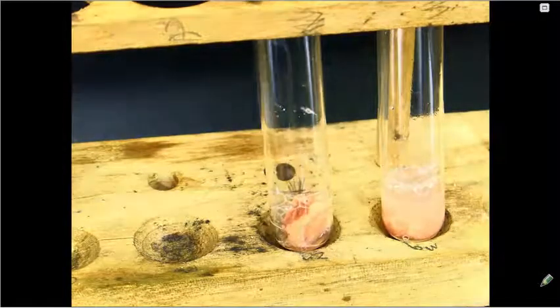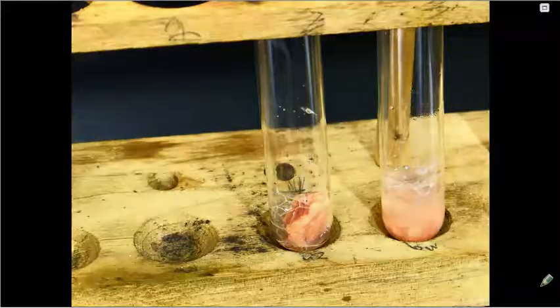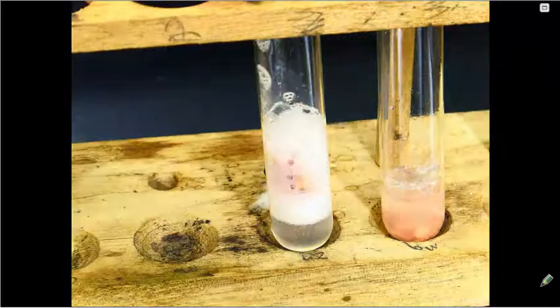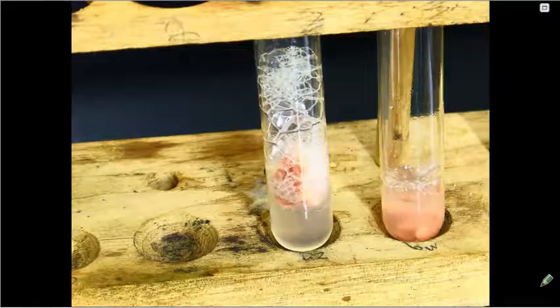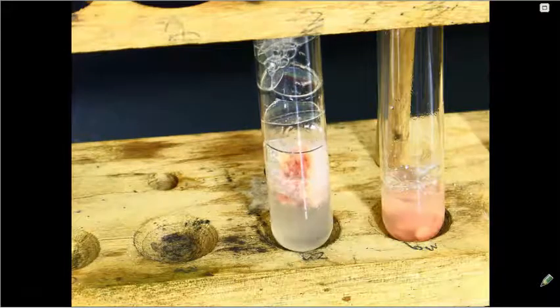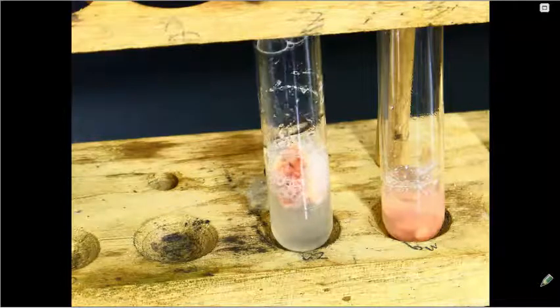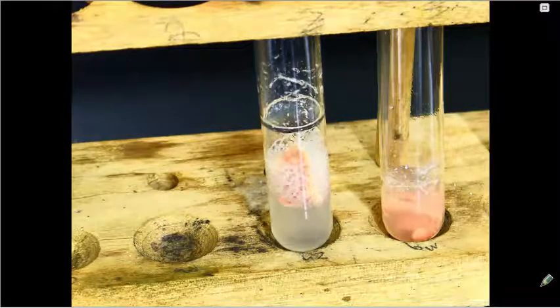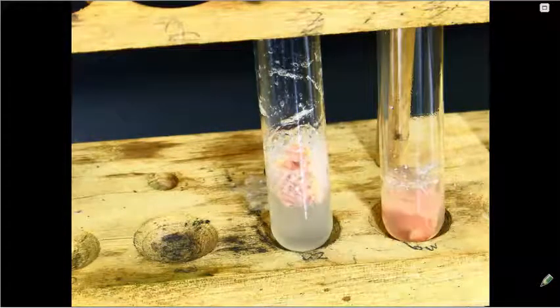I'm going to go back to our first test tube and add an additional 2 milliliters of hydrogen peroxide. Is it still having a fast reaction in that first one? So is catalase reusable? So is that first piece of liver able to continue doing that same reaction over and over again?